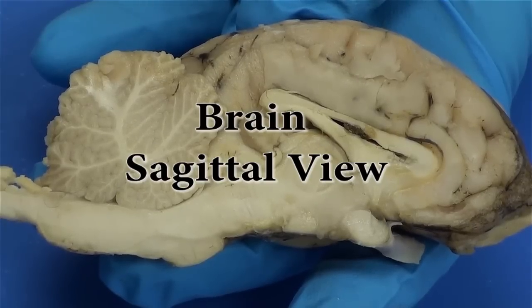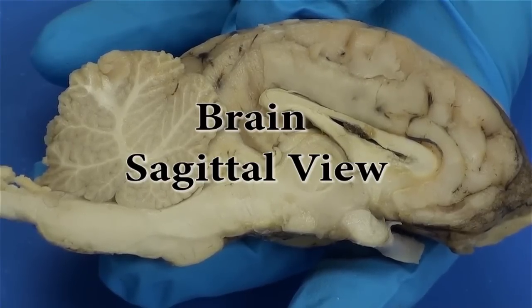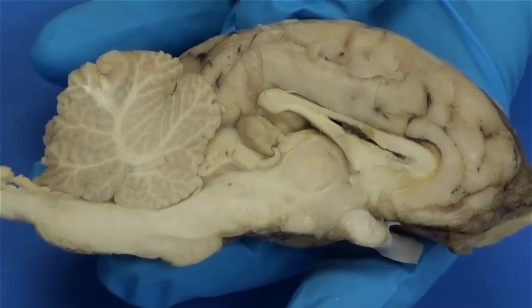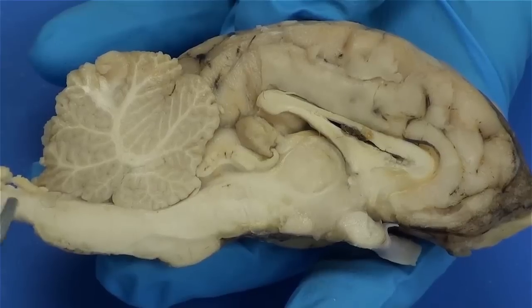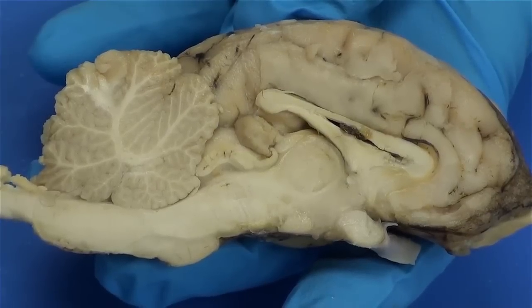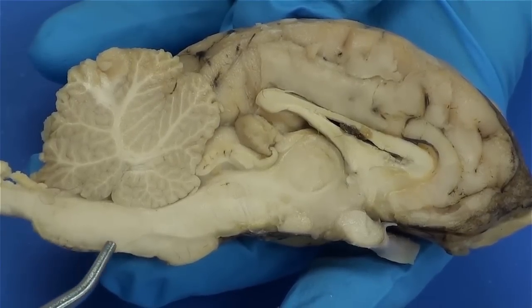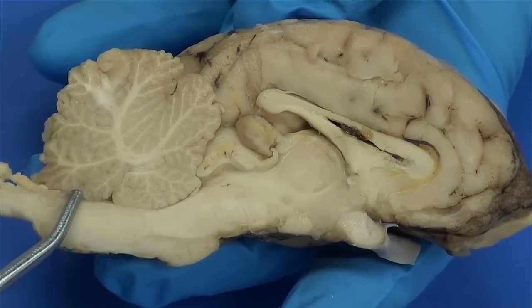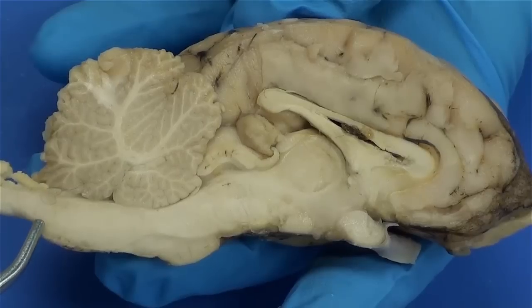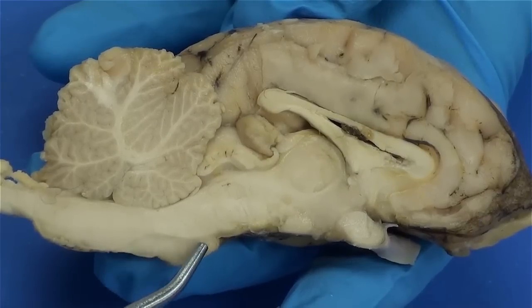Let's review the structures you can see in the sagittal view of a sheep brain. This is the spinal cord. This is the medulla oblongata. This is the pons.